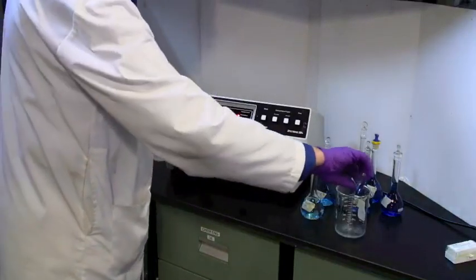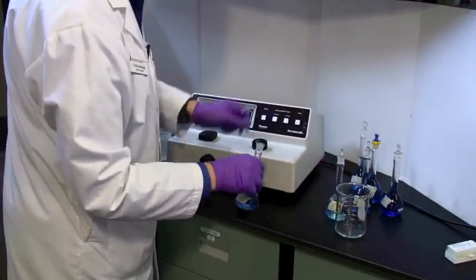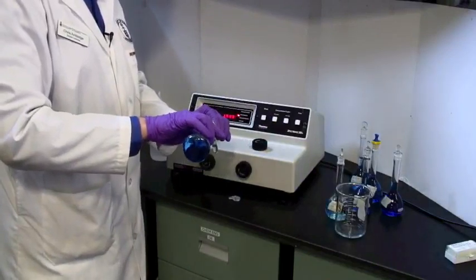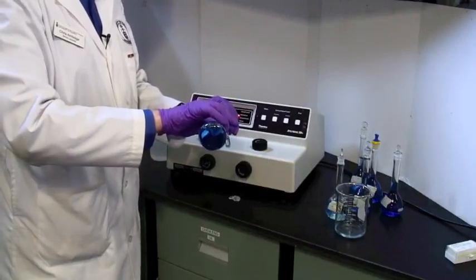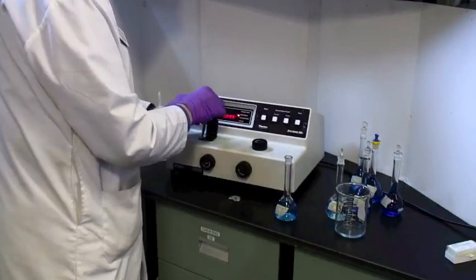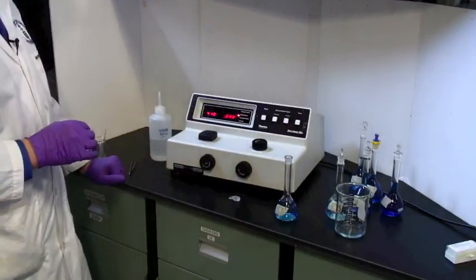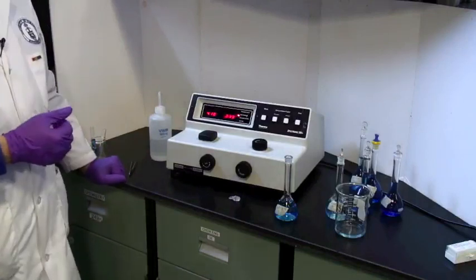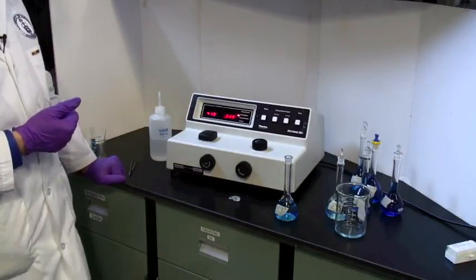Moving along, we dump that, and take the next solution. And again, rinse it with the actual measurement solution. You've got quite a lot of it. And pop it in, align it, and read again. And 2 times 10 to the minus fifth molar is a reading of 0.030. So, these solutions will all increase.